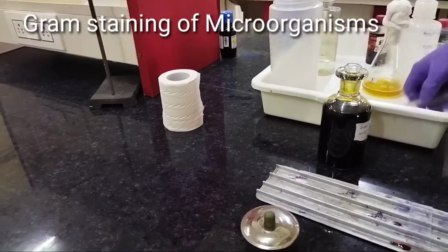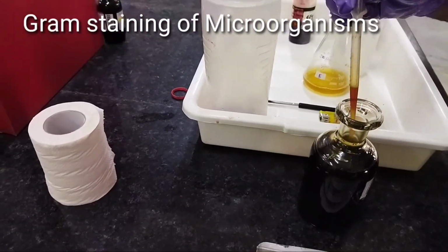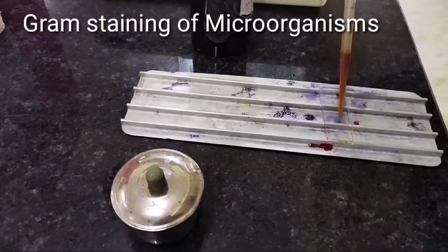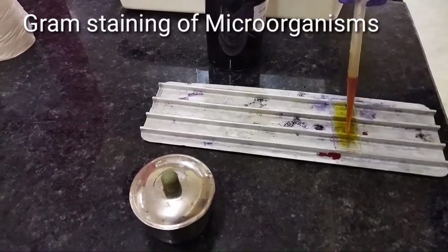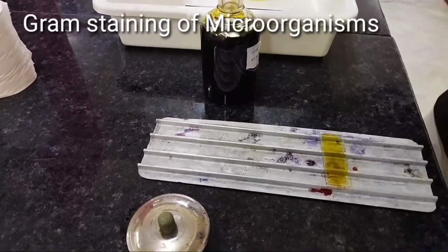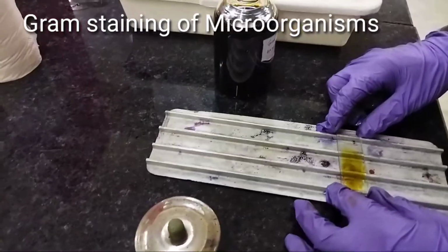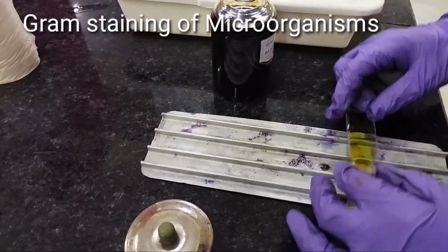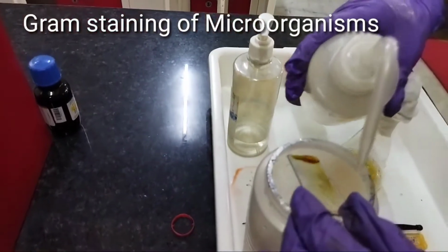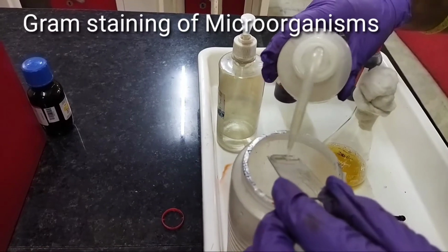Now we will use gram iodine on the slide, drop by drop like this, and allow it to stay for 1 minute. After 1 minute we will have to wash the glass slide again using a gentle flow of distilled water like this.